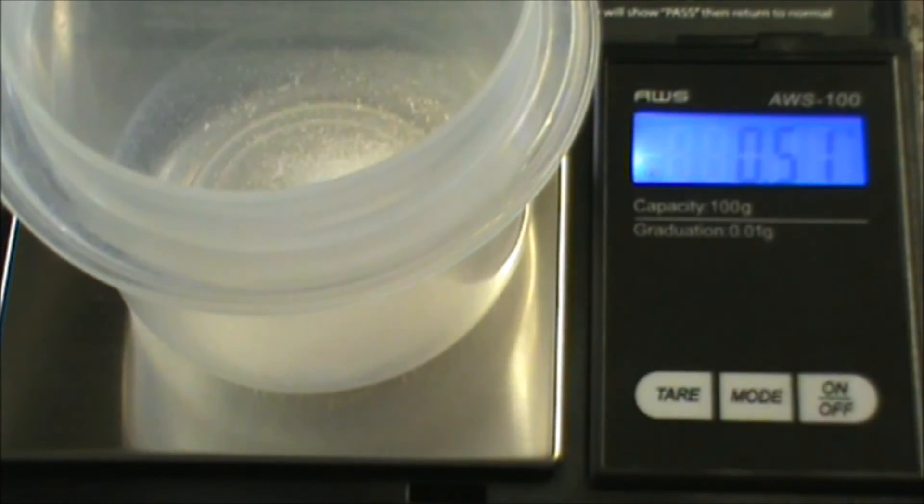I'm at 510 milligrams right here. So at this level I would probably stop.